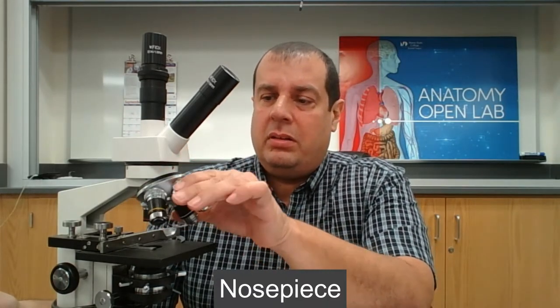Right here is where you're going to be looking to see the specimen — the slide that you're looking at. These are called the ocular lenses. There's one ocular lens here and another ocular lens up here. Then here you can see these are the body tubes that connect the ocular lenses, and we have the rotating nosepiece right here.